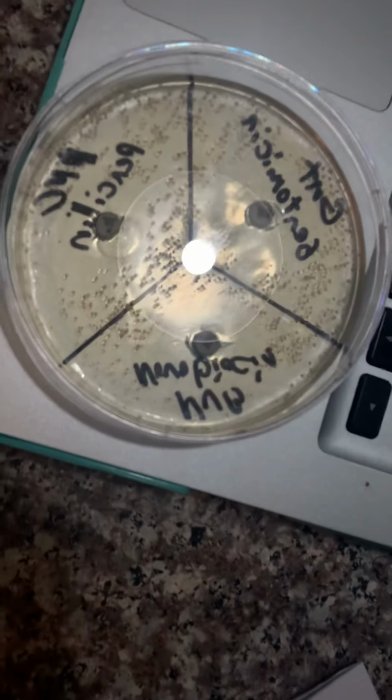On this experiment, I believe it went well. Here are my results. Oh, here, this is a better view. There you go.